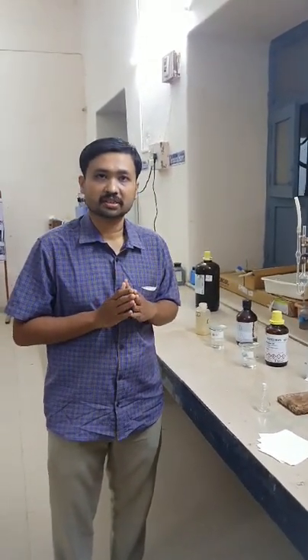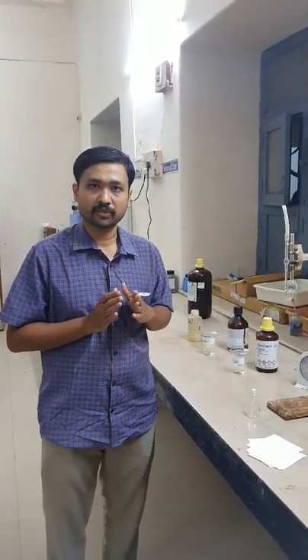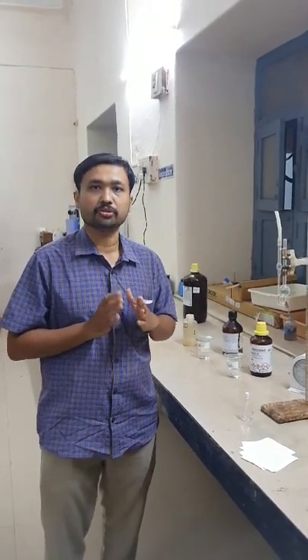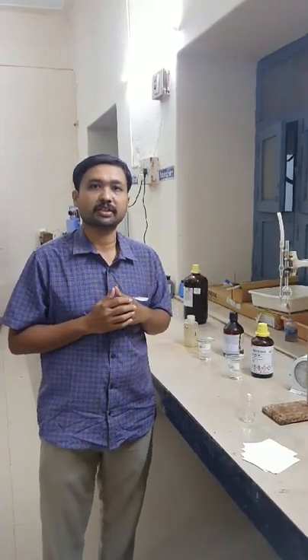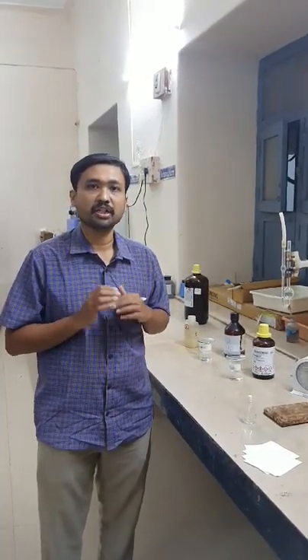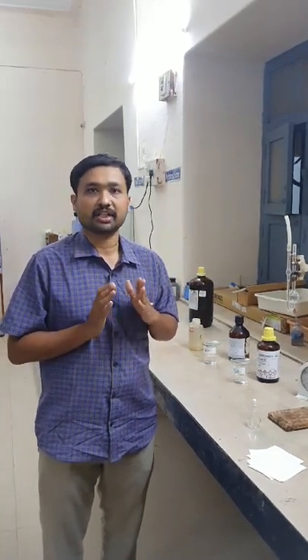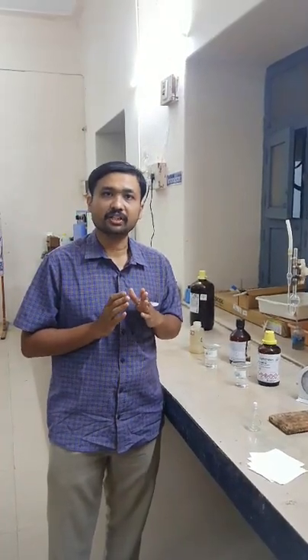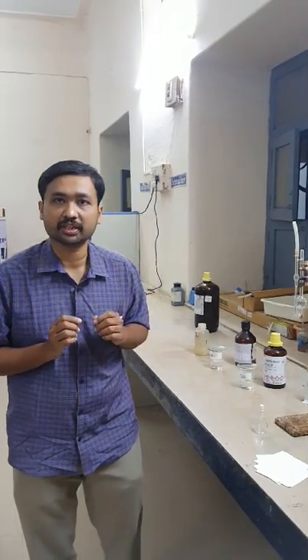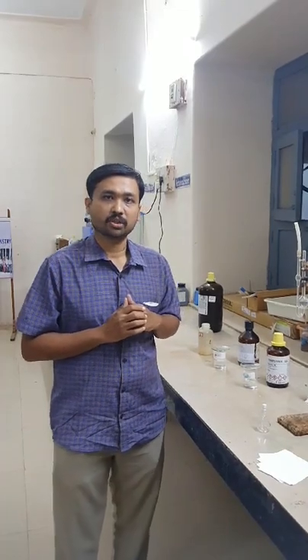The experiment contains two parts. Part A is determination of density of the given liquid, which has already been demonstrated by Dr. Narendra sir, so we will move on to Part B: determination of coefficient of viscosity. First and foremost, we have to record the laboratory temperature using the thermometer, taking utmost care, because both the density and the coefficient of viscosity of the liquid depend on temperature. It is very important to record the right temperature.